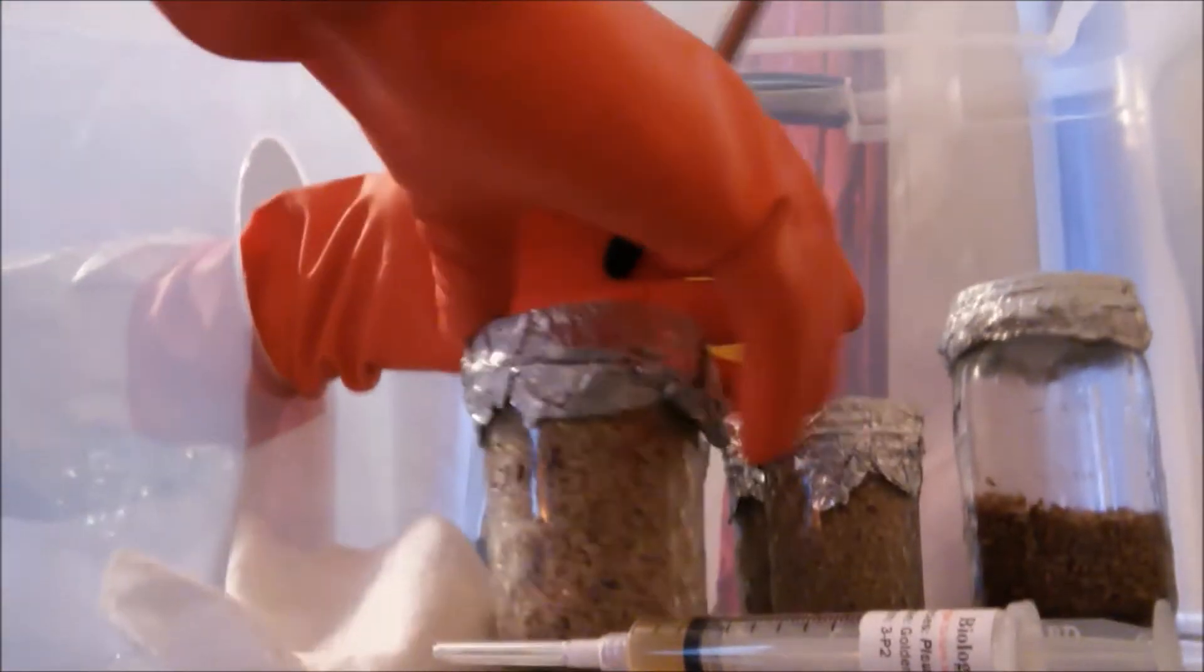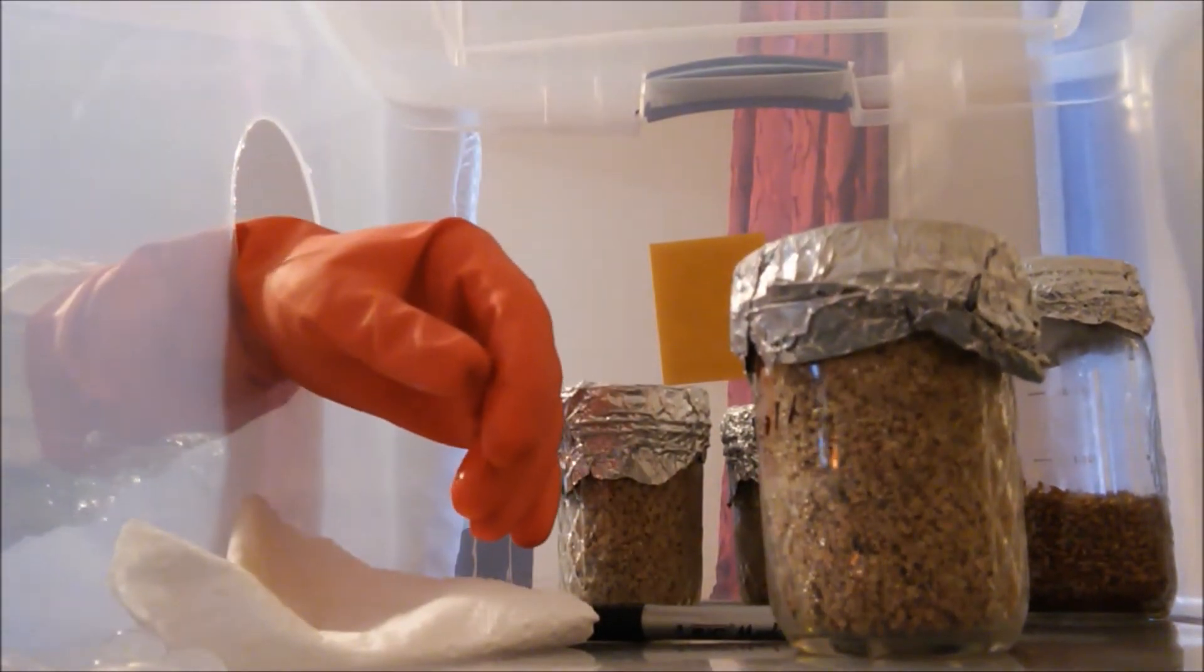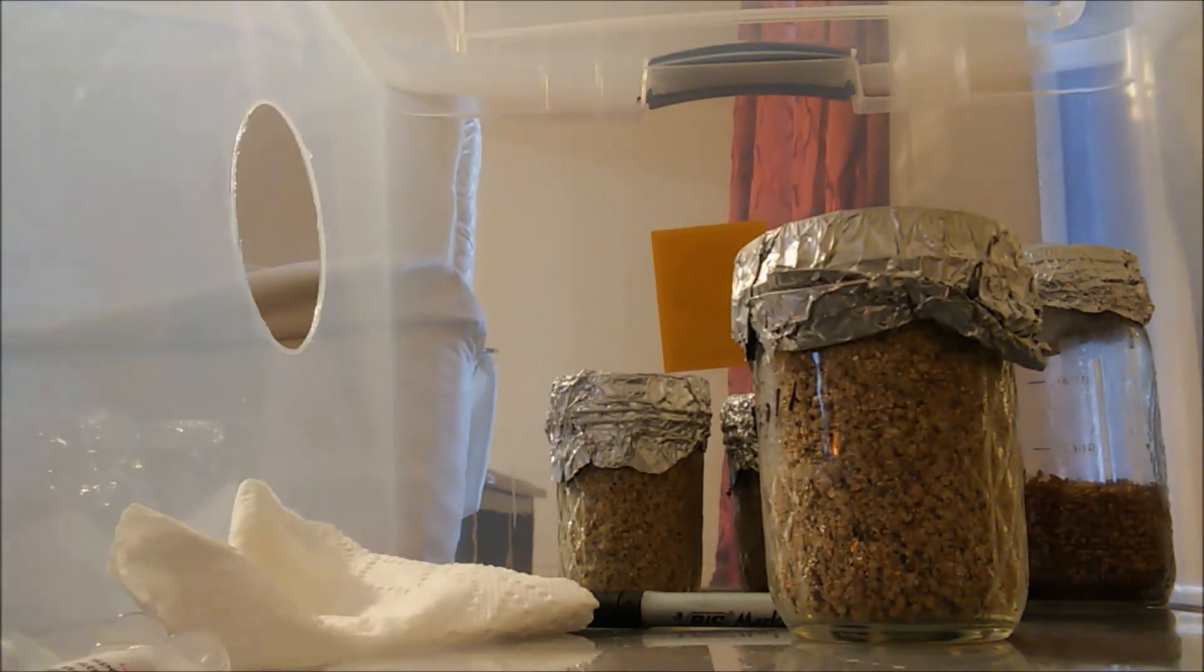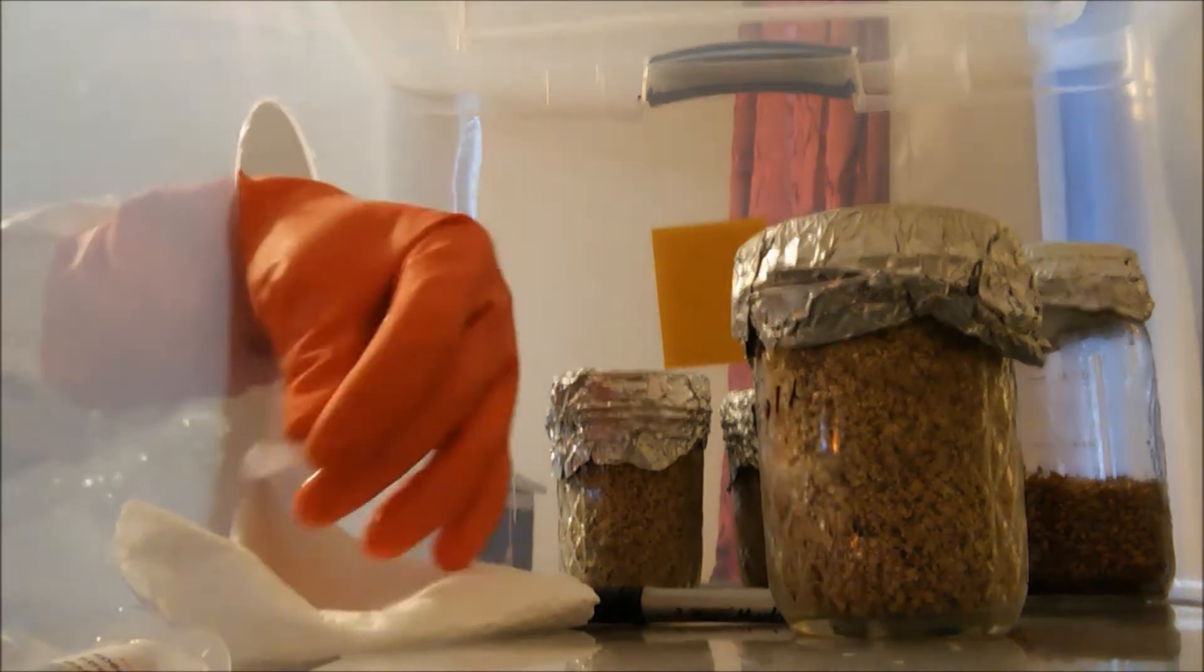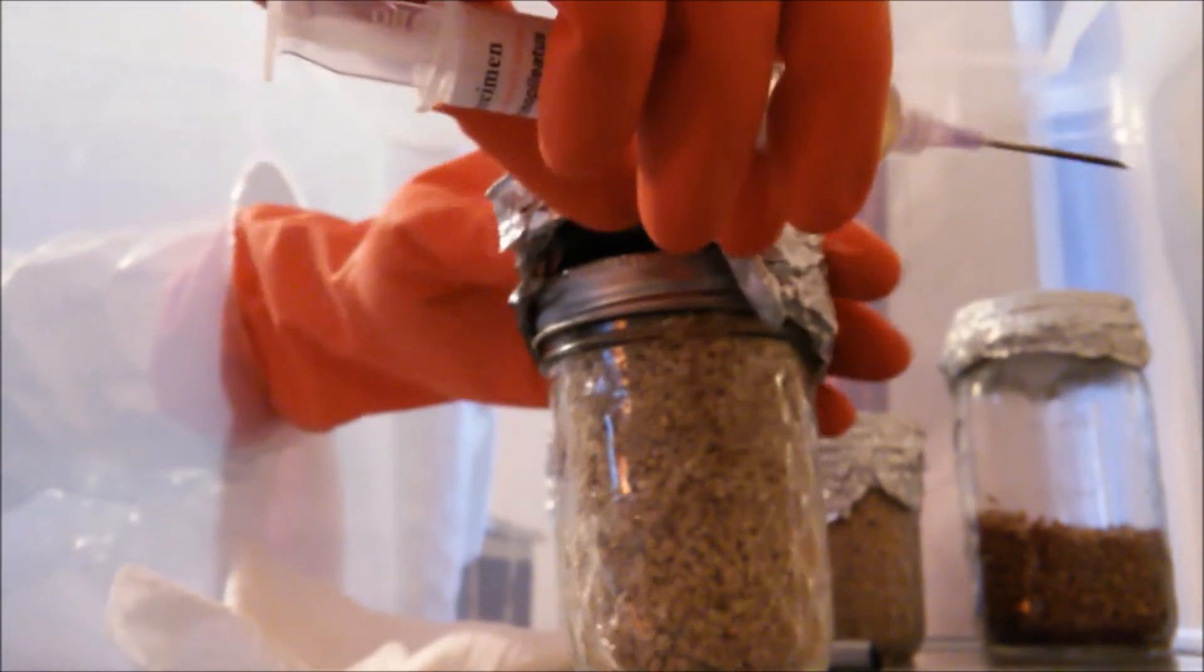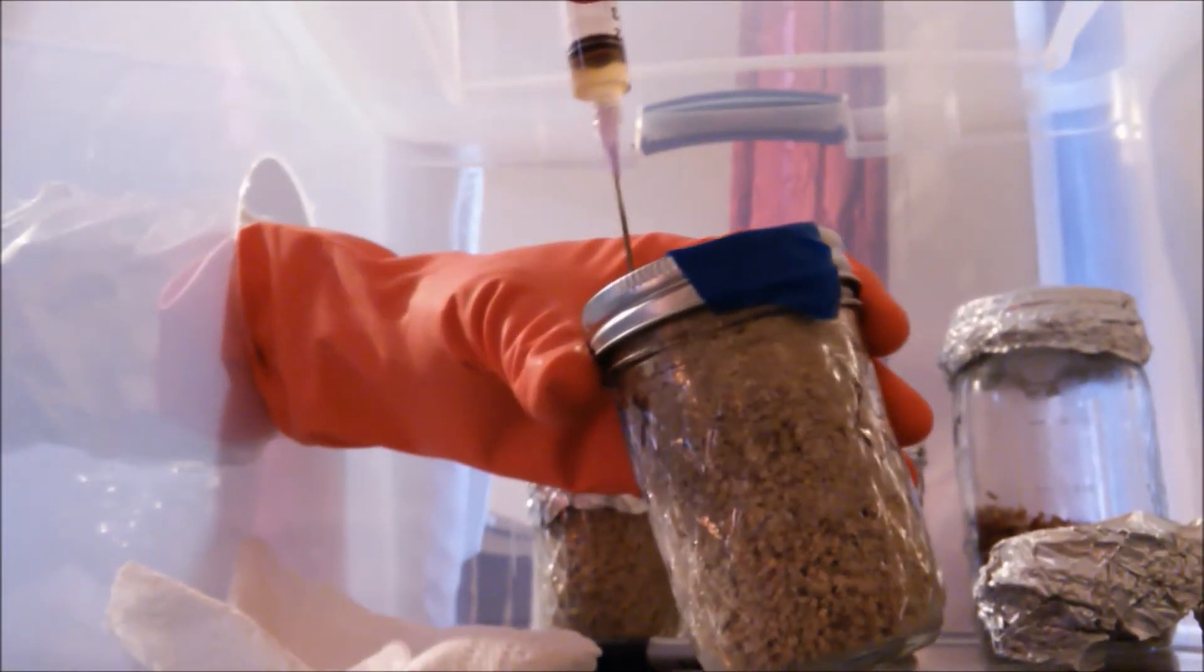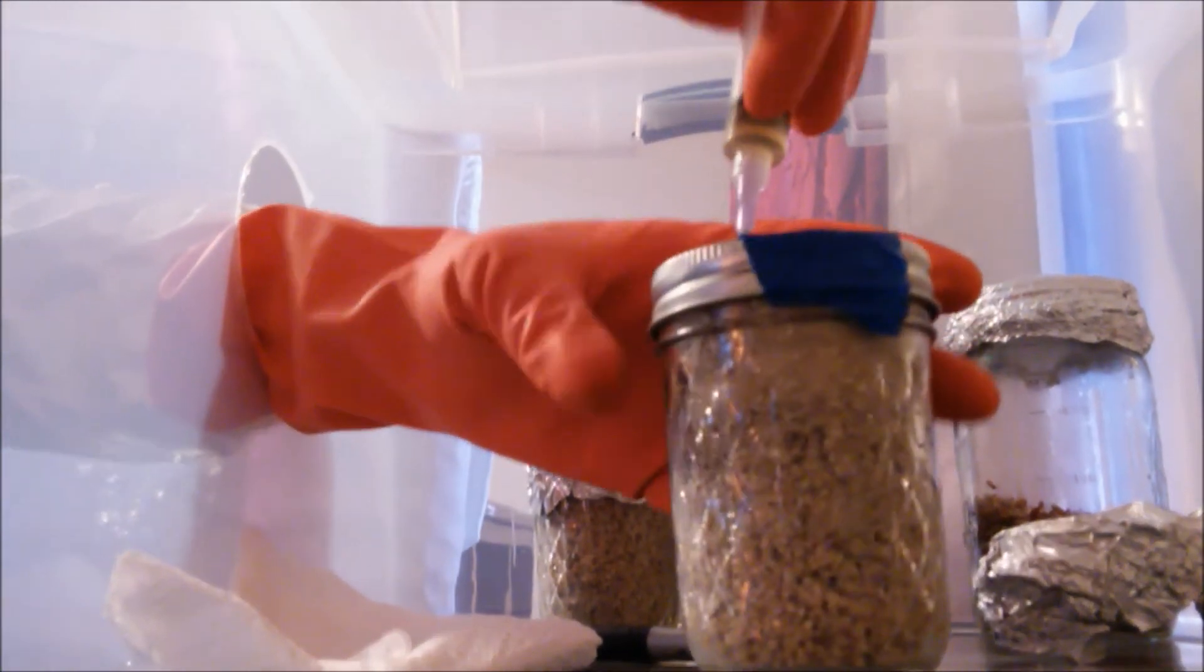All right, we're going to flame sterilize our needle. It's still very hot. Pull this back, find the injection site, and then go ahead and push it yourself through.